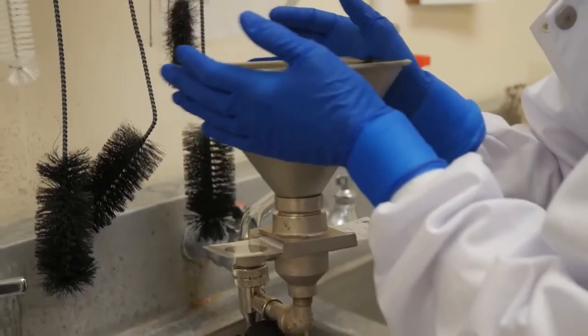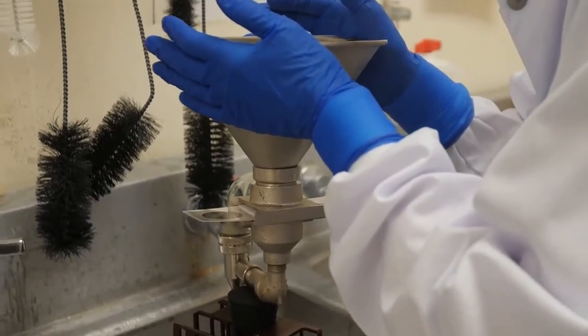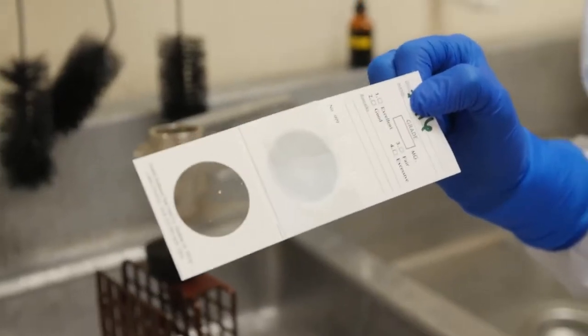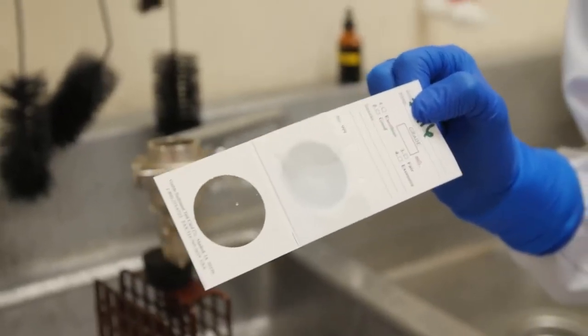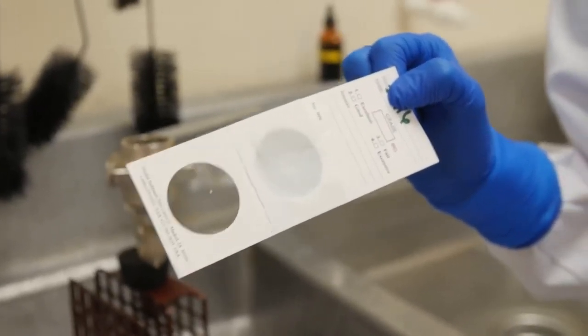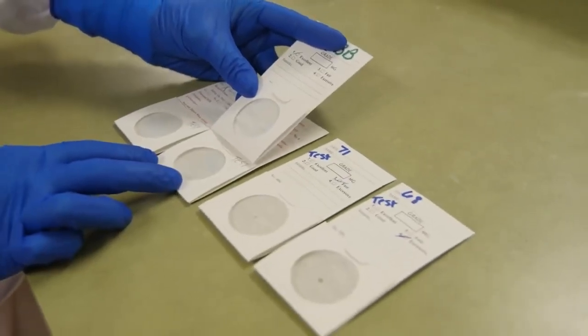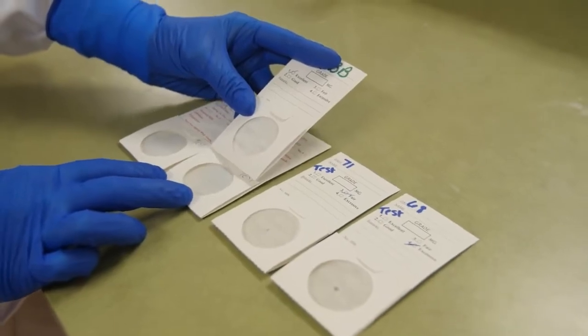Sediment tests usually involve filtering the sample and inspecting the filter disk. A clean disk means that the milk doesn't contain dust and dirt from improperly cleaned udders or other sources.